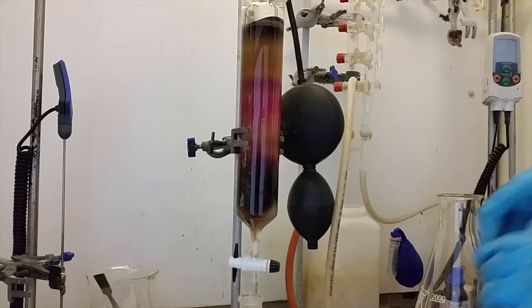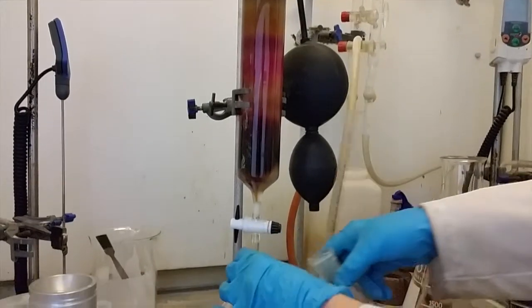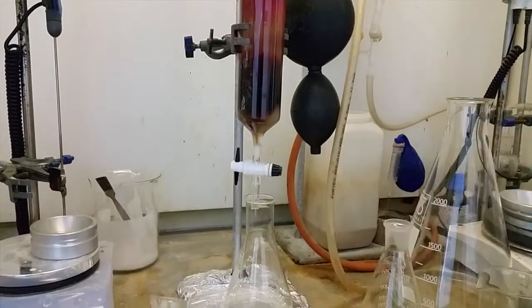At this point the product is beginning to elute from the column. You should now start to collect your small fractions to ensure you do not contaminate your product.